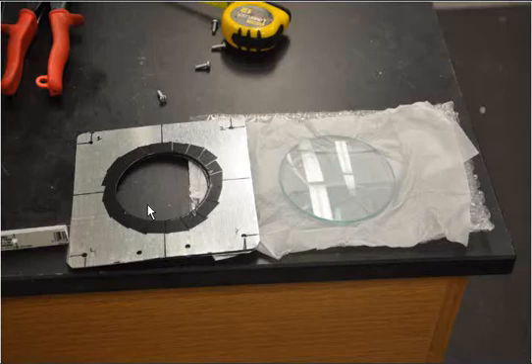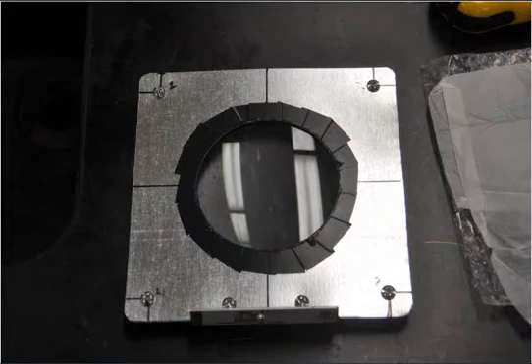And now that I have that done, I have my lens. I'm just going to set the lens in the hole and try to give 1 centimeter around the edge equally so that the lens is mounted in the center of the mount. Then I put in the screws and bolt it together, put the nuts in.